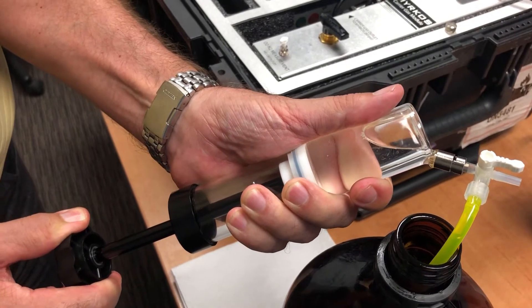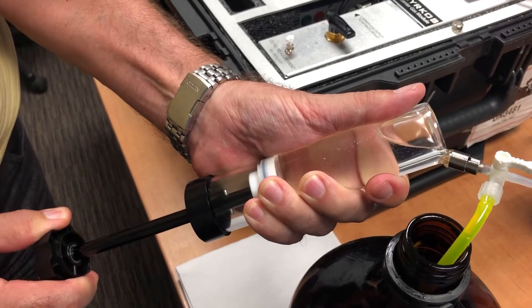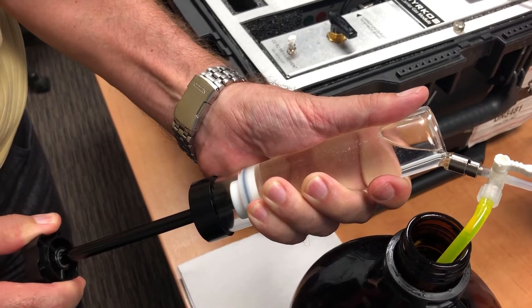To do the 9-gas, you need two syringe full of oil. You need two syringes, one for the 7-gas, one for the oxygen-nitrogen. So you fill up the syringe.